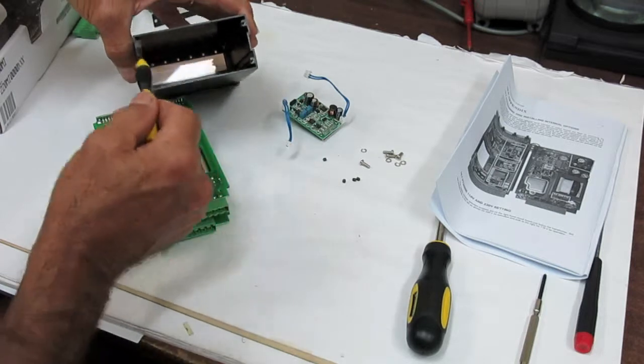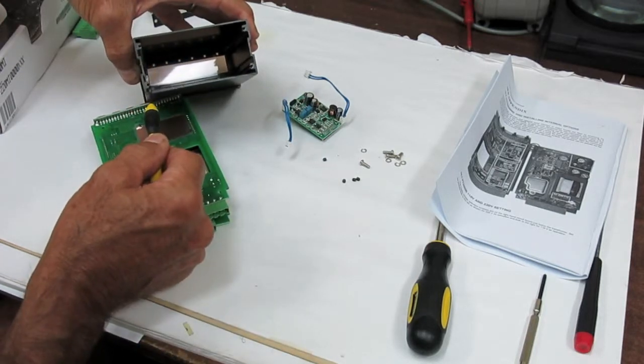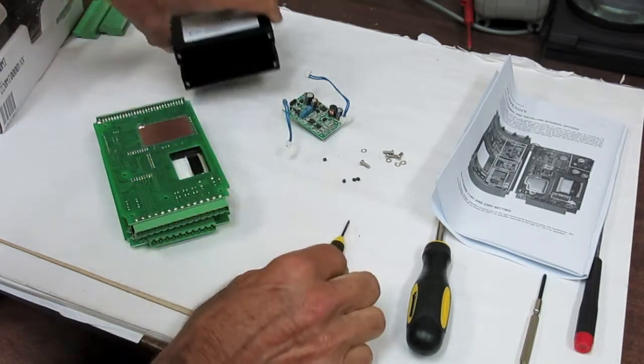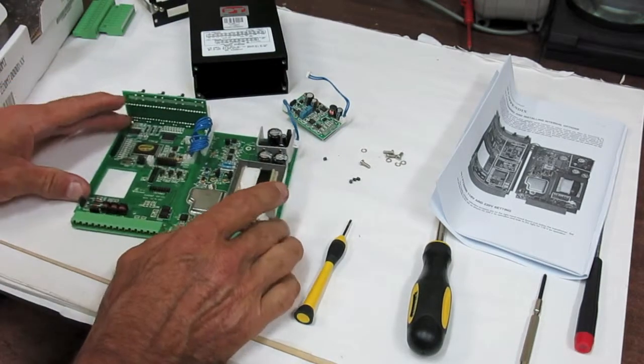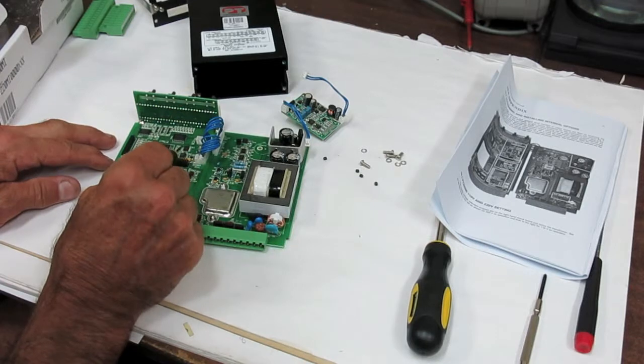These circuit boards slide in these small grooves under the screws. Open the circuit board. The analogue option fits here.